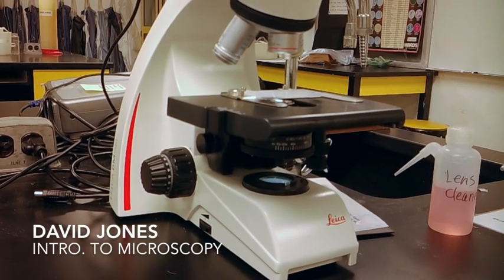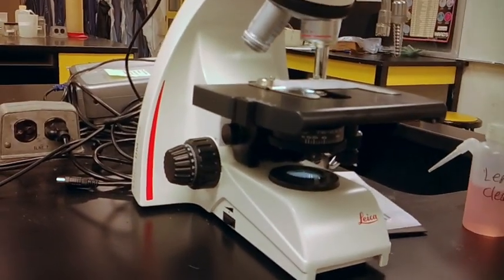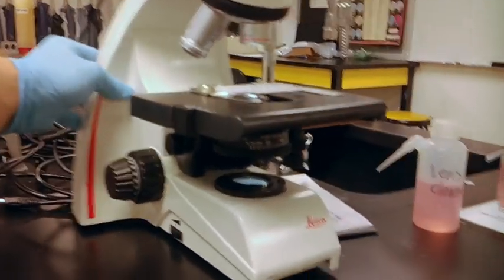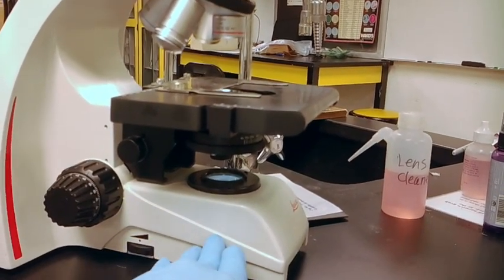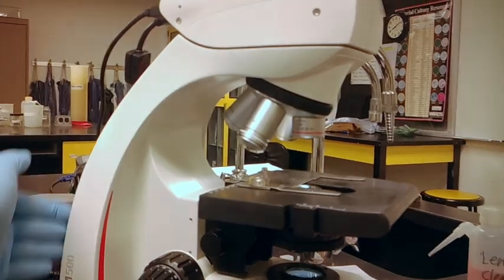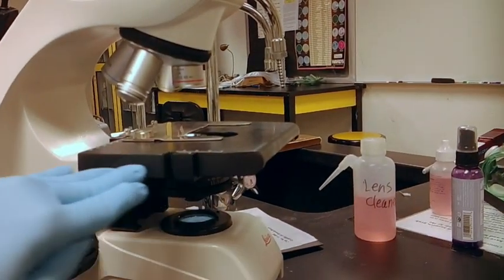Today we're going over the pieces of the microscope. So to get started, on your microscope here, we're going to have a base at the bottom, an arm of the microscope. You'll have the stage right here.